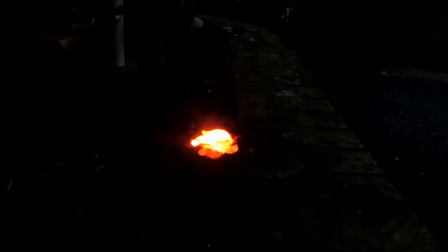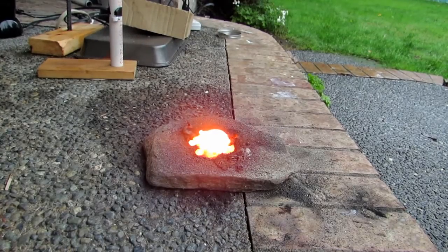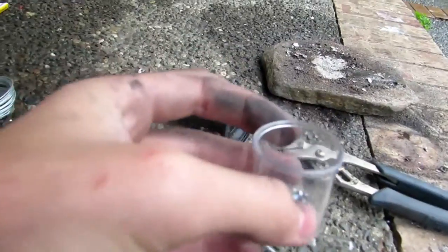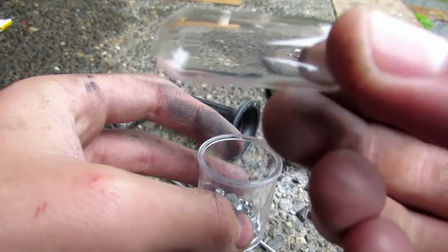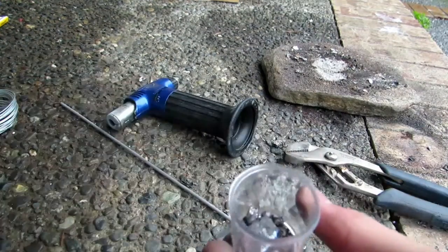That is very, very bright. So I'll let this cool and we'll see if we got any manganese metal. We got a huge amount from all that, and you can see all the rest of the reaction material. Here's our old sample of manganese — you can barely see it. There's a tiny dot of manganese metal, which is not very pure and it's barely anything.